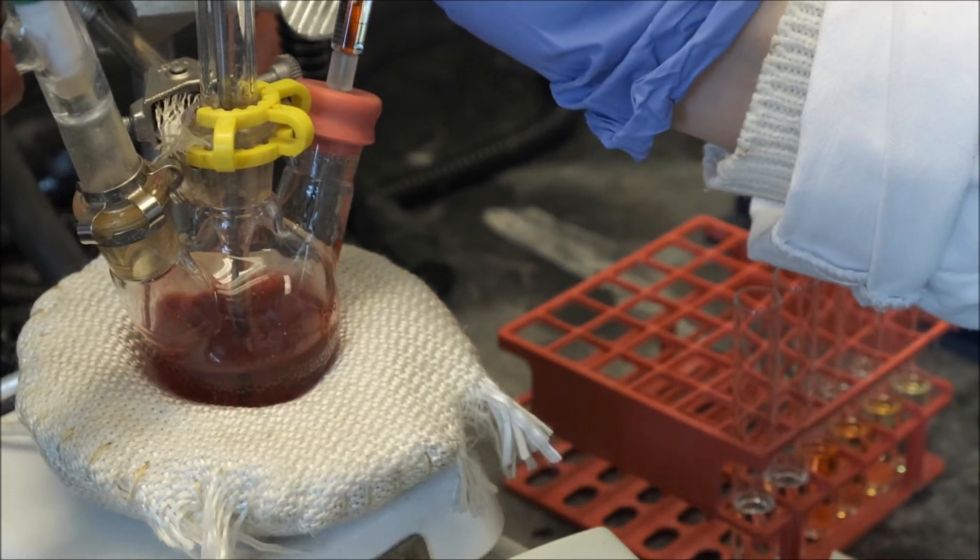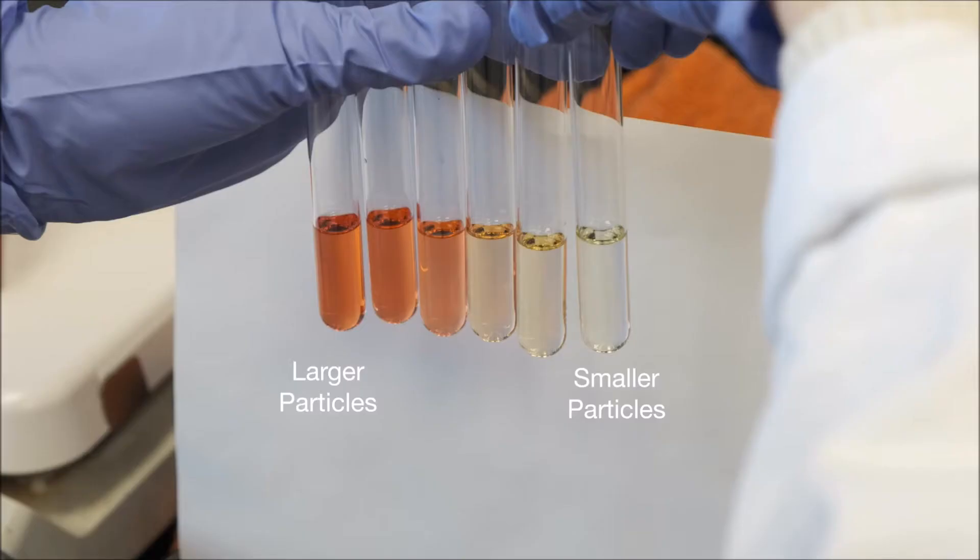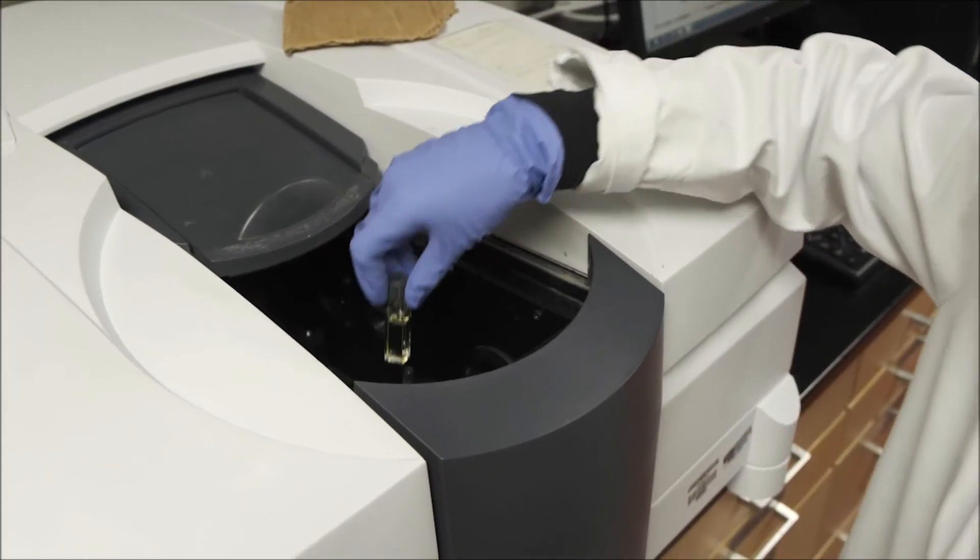When we compare the different aliquots, we see they exhibit colors ranging from yellow to reddish orange. This is because their absorption maxima vary with size due to the quantum confinement effect. As the reaction progresses and the particle size increases, the absorption feature progresses to higher wavelengths.